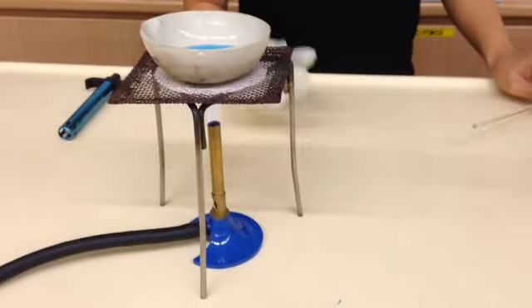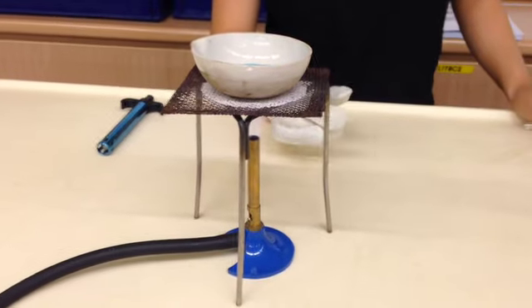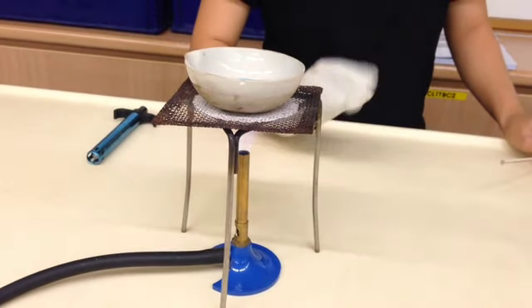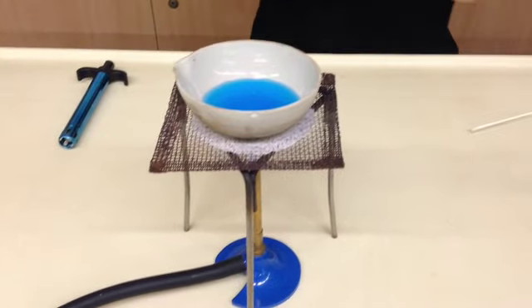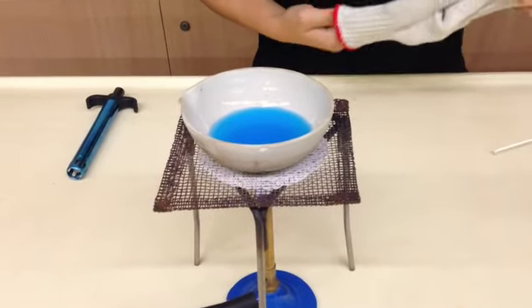At this point in time, you should not be touching your evaporating dish. You should just let it slowly warm up and let the water evaporate away. This process can be a bit long, so you will just have to wait.